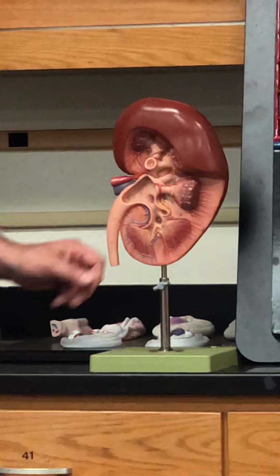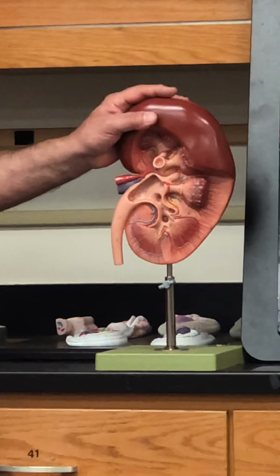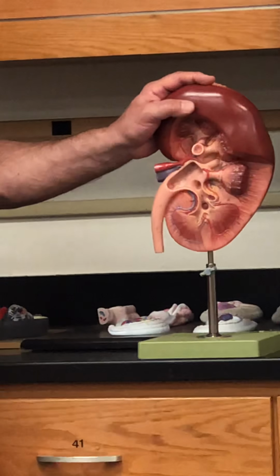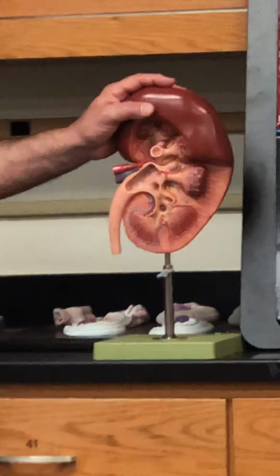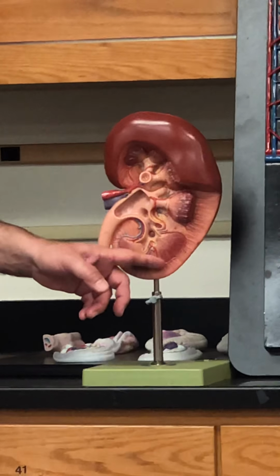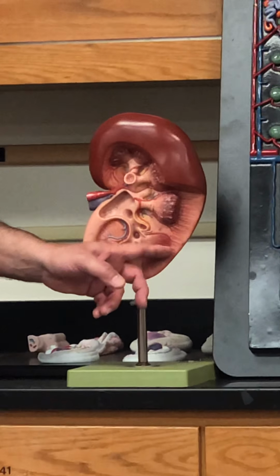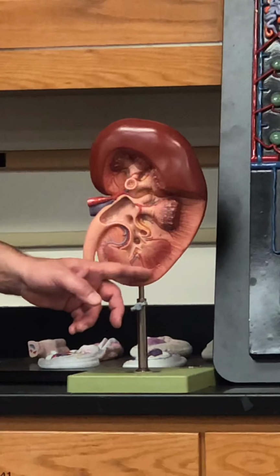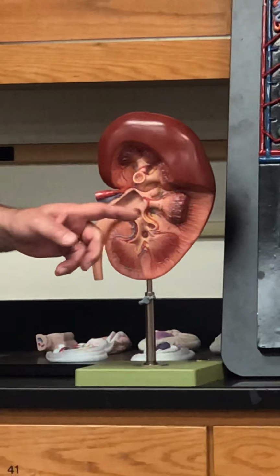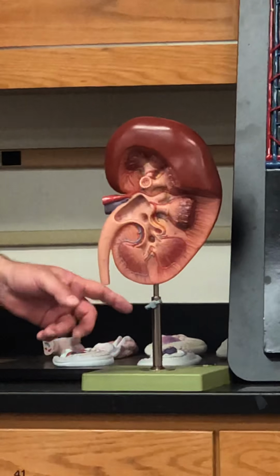So the majority of the, what is the unit of the kidney? What's that called? The working unit of the kidney. The nephron. Right? There are 1 million nephrons per kidney. The majority of the nephron is located up in this structure. The blood itself makes its way through this artery. What's this artery called? Arcuate. It arches, arcuate. And then the arteries that emanate, it looks like they kind of radiate.